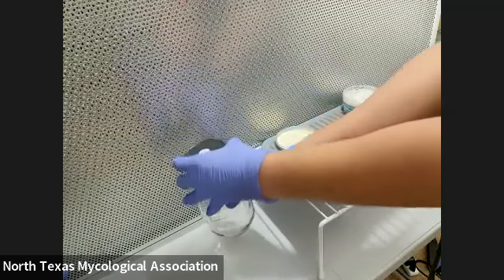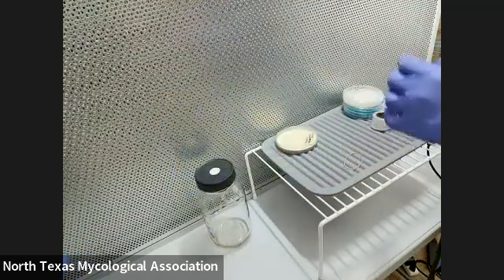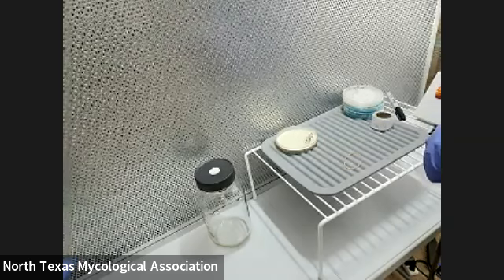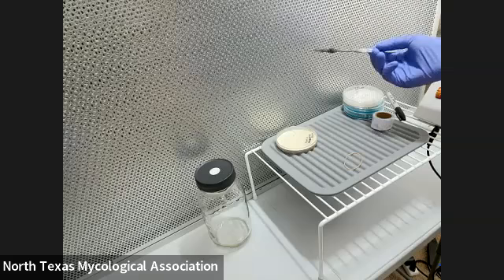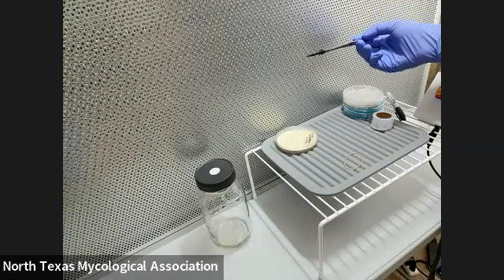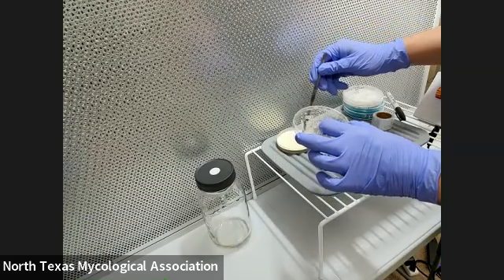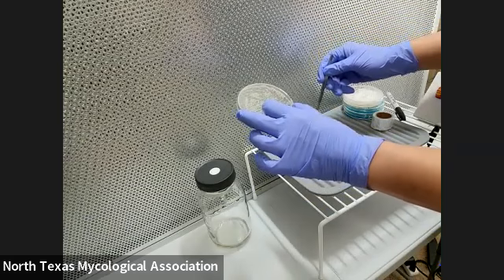With this, I like to try to loosen the lid so I can open it up with one hand. I'm going to sterilize my scalpel again. We're just going to cut a bigger triangle or square, just because we're trying to inoculate a whole jar of grain, so it needs more mycelium in there for it to work well.